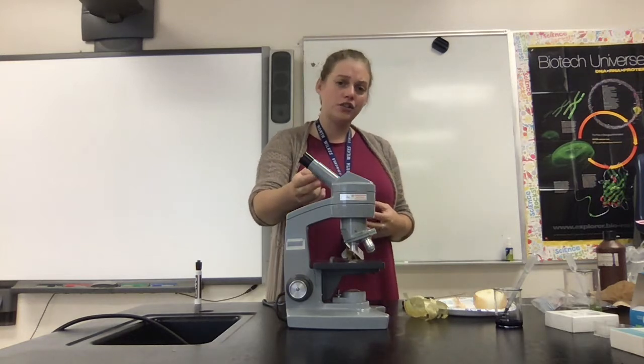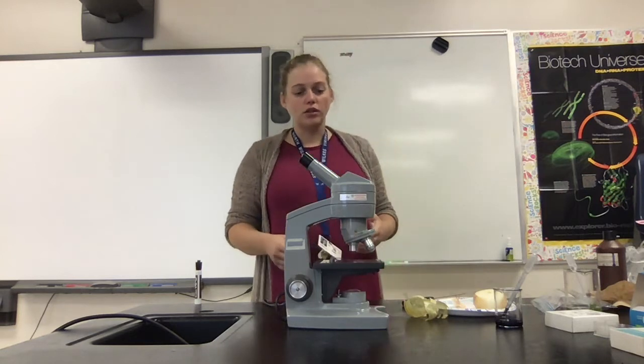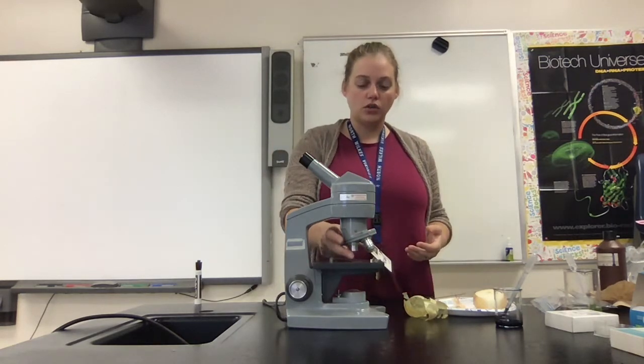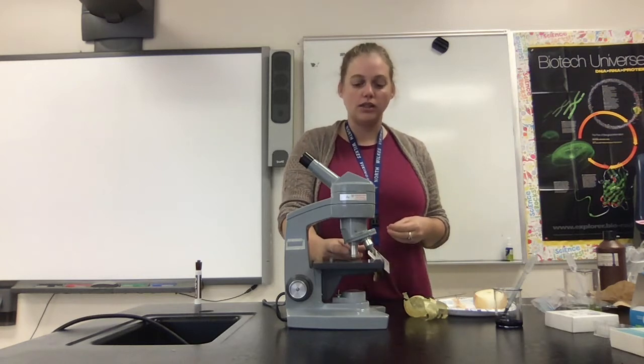In addition to the lens in the eyepiece, we also have lenses on these objectives that you can see me spinning here. The objectives have different lenses of different powers. The smallest objective has a lens that magnifies something to be 4 times larger. Our next objective has a power of 10, and our strongest objective on this microscope has a power of 43, magnifying something 43 times larger than it normally is.